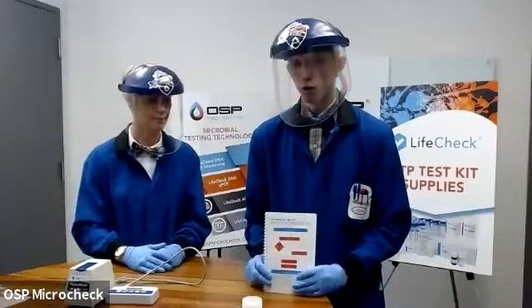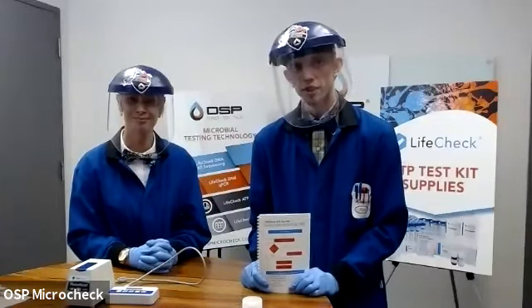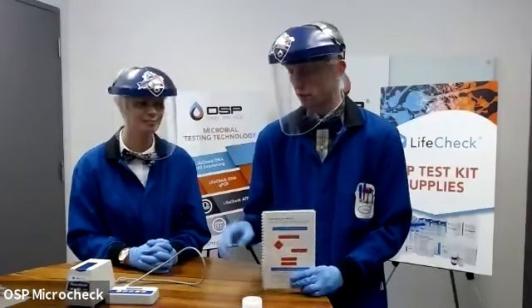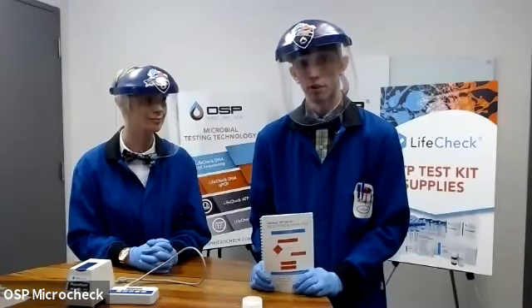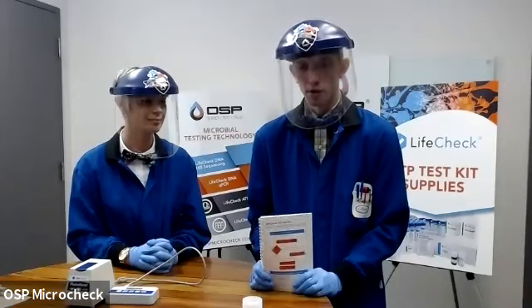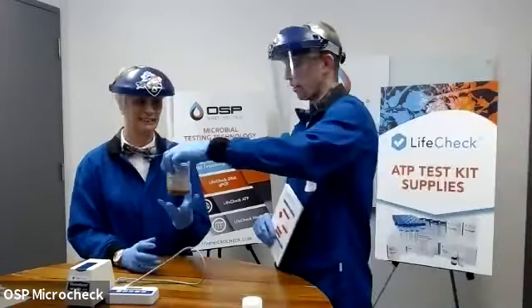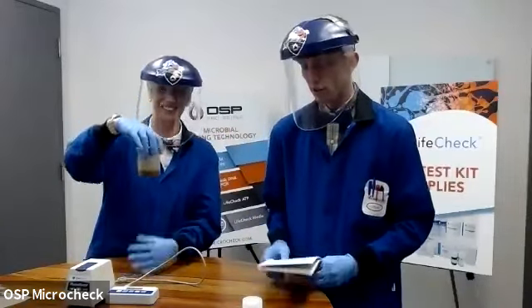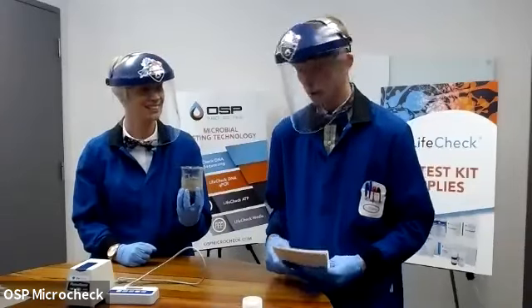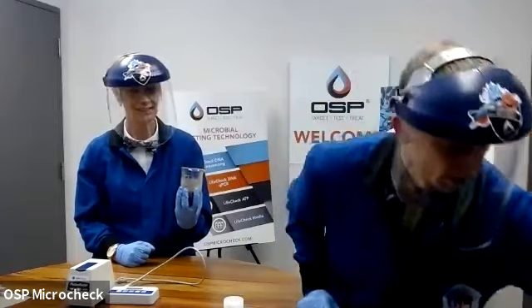So one of the first ones I want to talk about, and we kind of brought this up earlier, is what if you couldn't squeeze or filter syringe 1 or even 5 mils of your sample? When you're starting to sample such a low volume as that with the Planktonic methodology, you might start to wonder if you're missing microbes or if you're going to be too close to your limits of detection. Or maybe your sample is just so viscous, like the sample we have for you here today, Virginia, that you're not going to be able to syringe filter any of that. So for that, we do have what we call our Sessile soak method. And this is a workaround that actually makes use of our Sessile ATP testing kit.